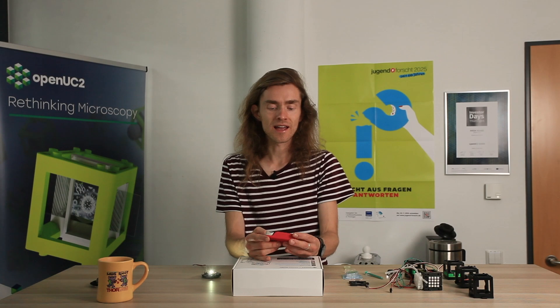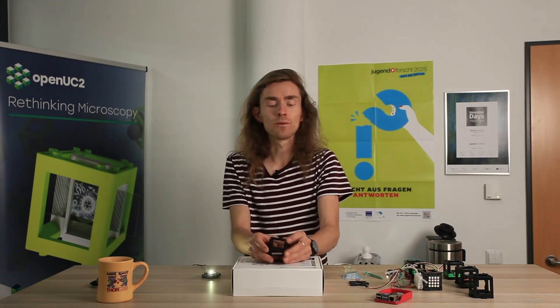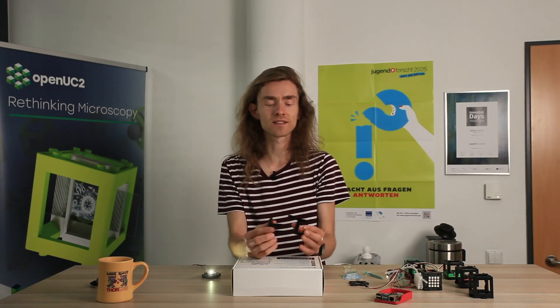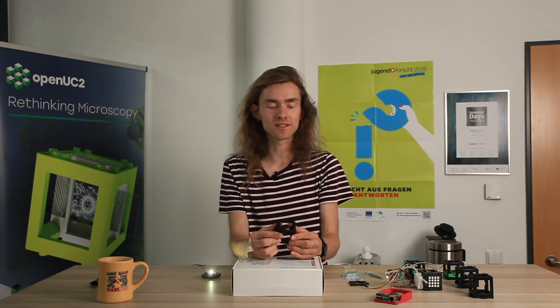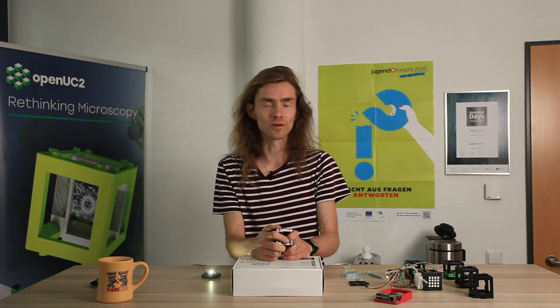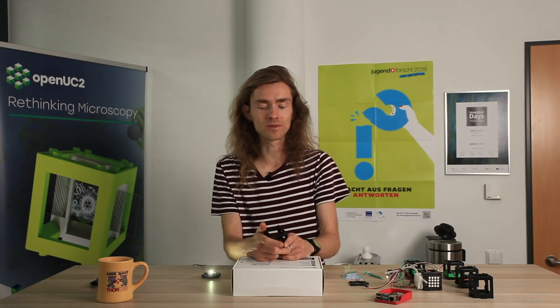I think everybody knows this piece here. It's a Raspberry Pi and it revolutionized electronics. So we are trying to do the same for optics and we have been working on this little cube. You can open it and you can fill it with whatever you have — lenses, cameras, lasers, illumination sources — and the cool thing is it's open source, it's modular, and you can bring different elements together.